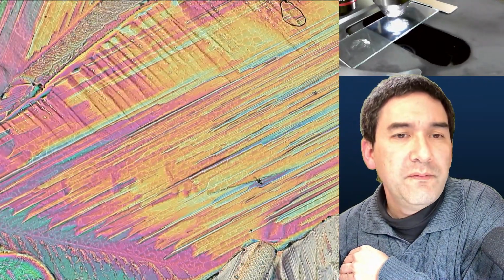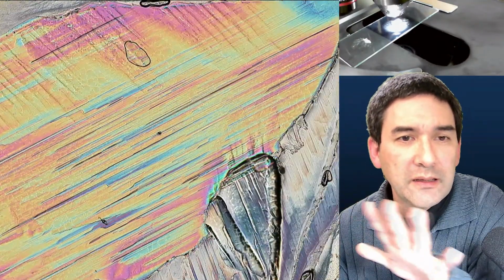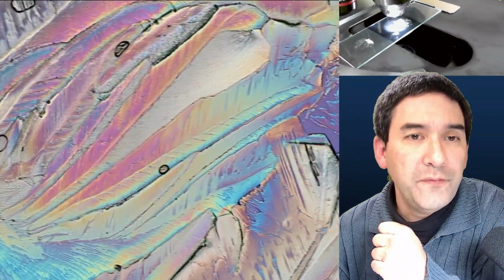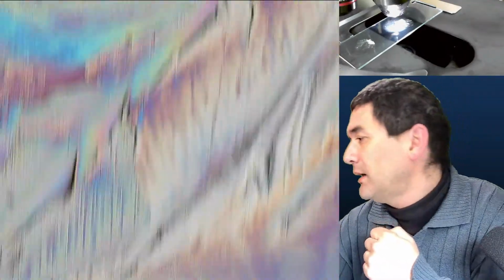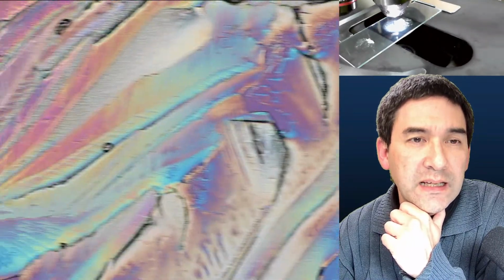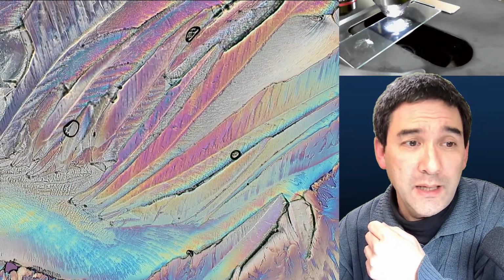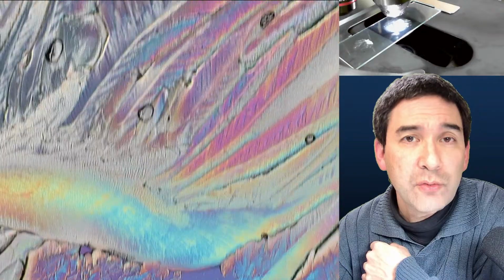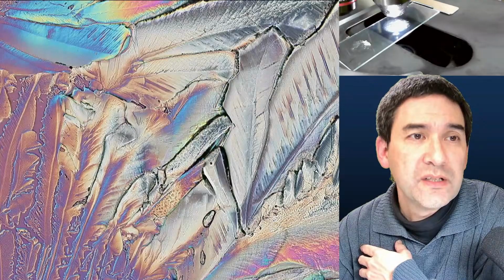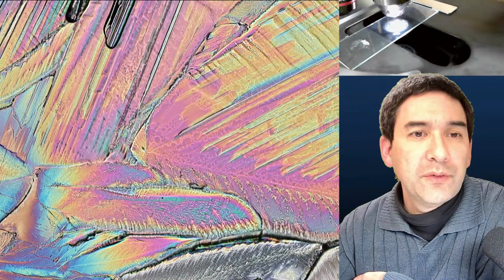This is a very typical thing here. Citric acid likes to make those very flat parallel structures, almost like a fan, or feathers even. What I've done here is I made a saturated solution of citric acid on the slide, and again, just like before, it did not really dry very quickly. So I added some additional dry citric acid crystals into the solution. This acted as a crystallization seed, and this is where more crystals started to form. We can play a little bit around here with the colors.